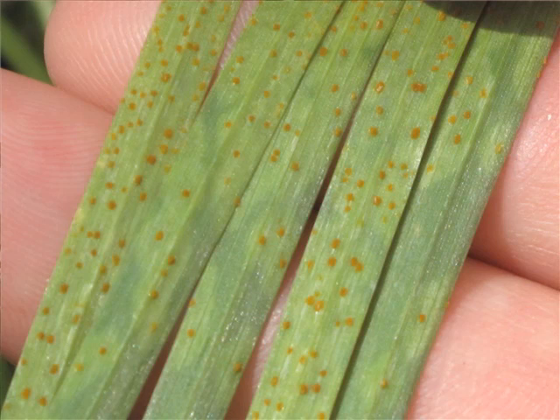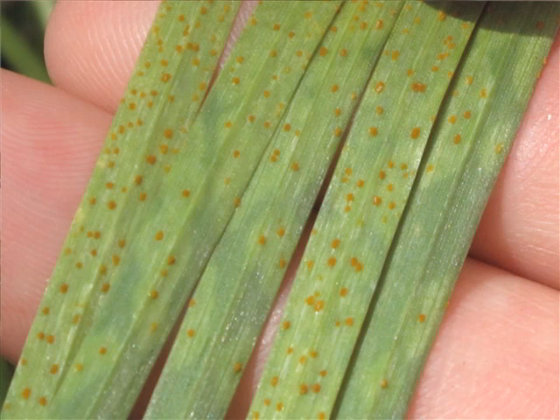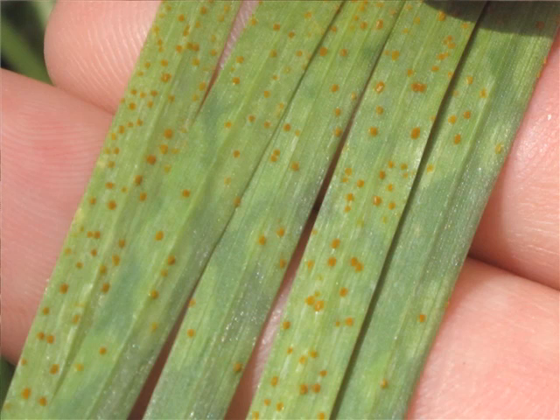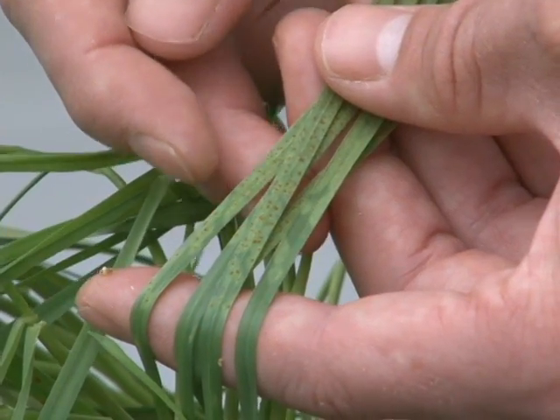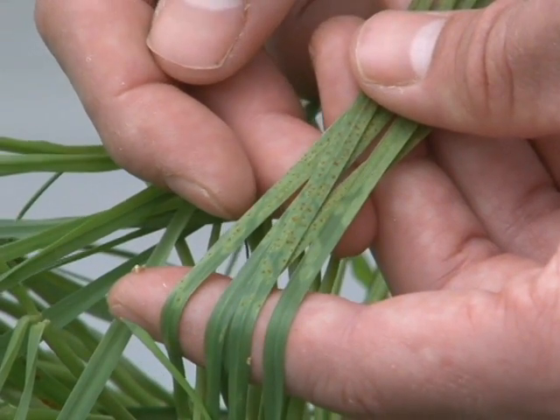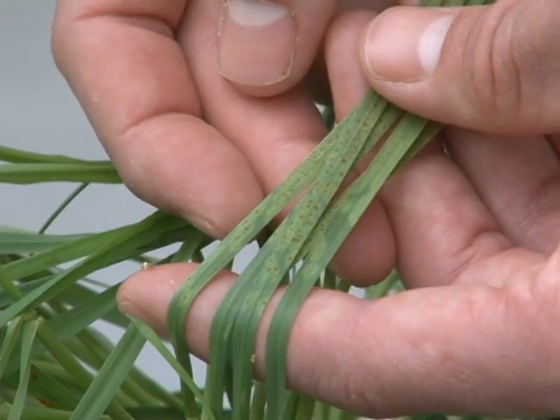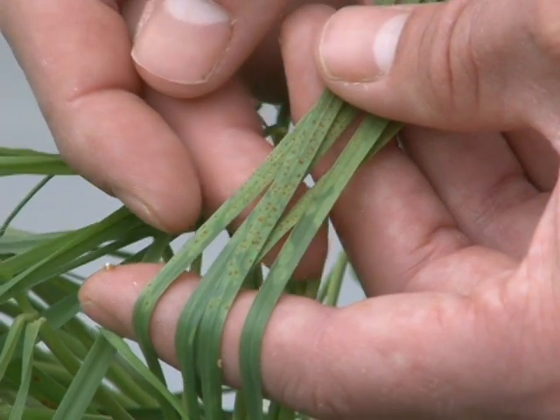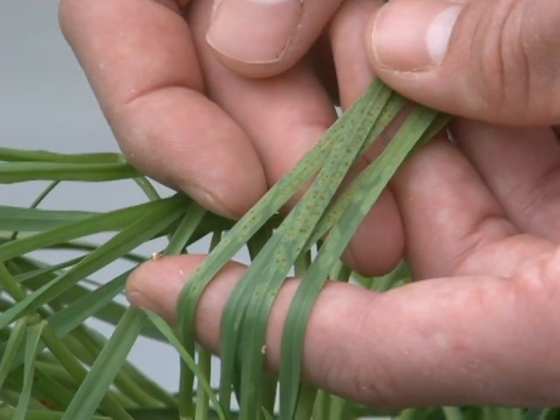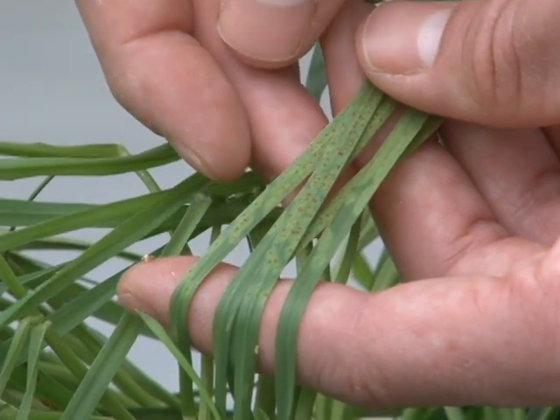You can also see that there is a green island surrounding the sporulating area. The small pustule size, the round shape, and the green islands are indicative of a two infection type.